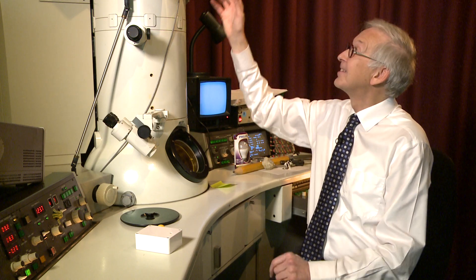The electrons are traveling incredibly fast — if you pointed this column at the moon, the electrons would get there in a few seconds. They zip through the specimen, and there are lenses above which focus the electrons onto it. After the specimen, more lenses down here magnify the image. On the screen, you can get an image magnified 10 million times. We start by looking at lower magnification and then work up to see atoms or near-atomic resolution on the screen.